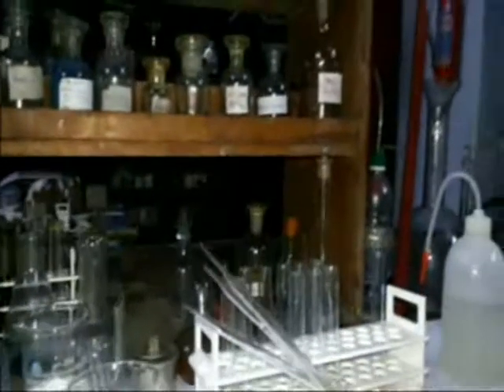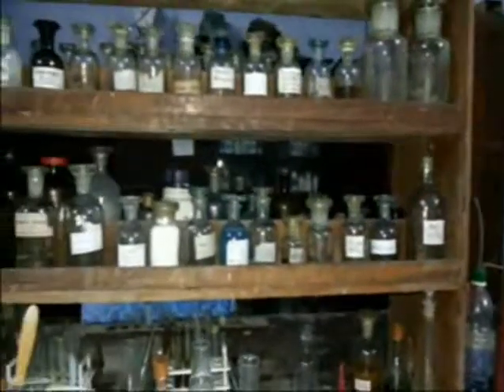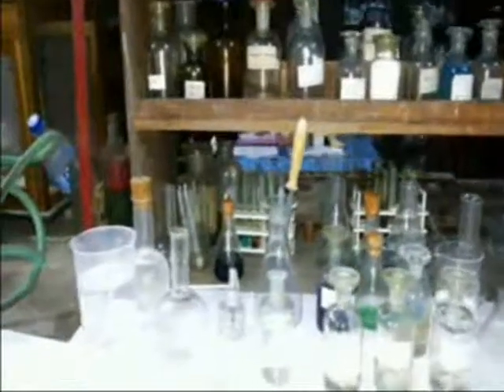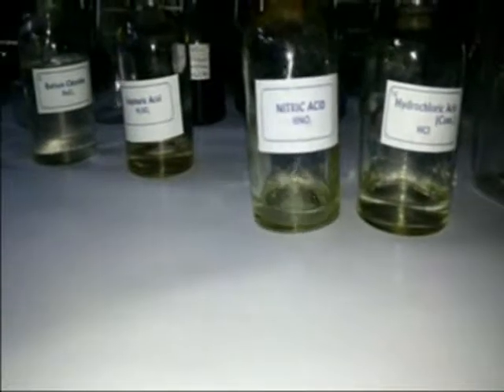Let us begin with the effect of aqueous barium chloride on each of three common lab acids — HCl, HNO₃, and H₂SO₄. Look, this is hydrochloric acid, this is nitric acid, and this is sulfuric acid.